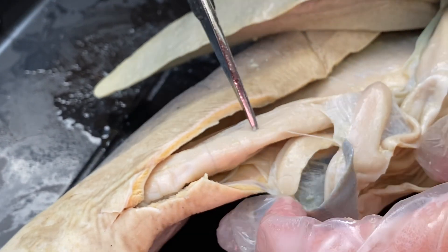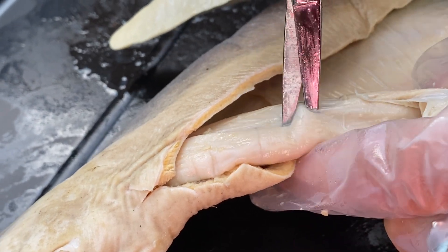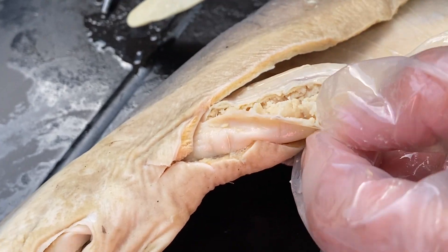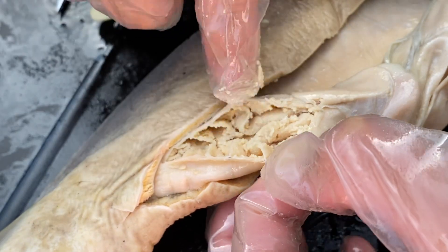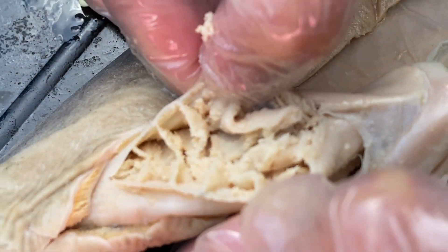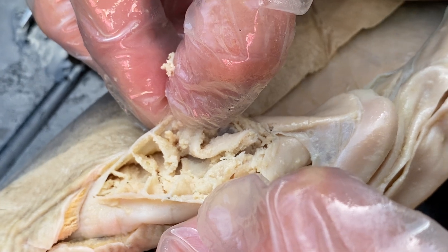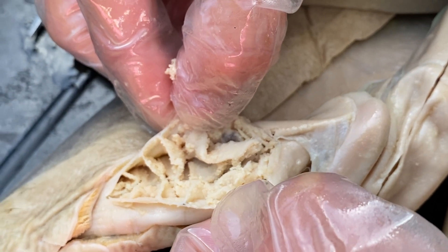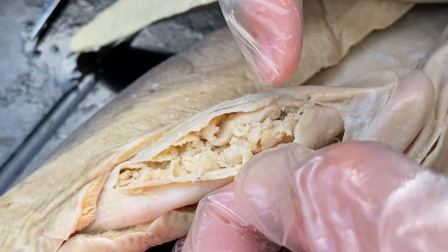Going from the spleen, you go down into what is called the spiral valve, or also known as your intestine. I'm going to cut through the spiral valve and open it up so you can actually see what is so unique about sharks' digestive tract. This shark is really small because it's a juvenile. But if you think about our intestine — some 40-something feet of intestines inside of our body jam-packed — this is obviously a very small digestive tract. So in order to slow down the digestive process and not just eat and excrete, they are slowing down the body by having something called a spiral valve.